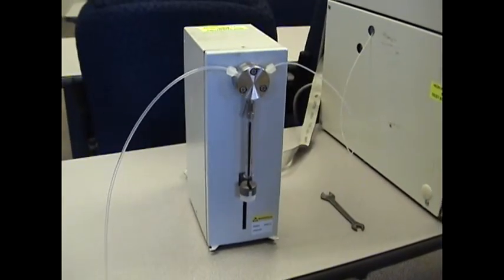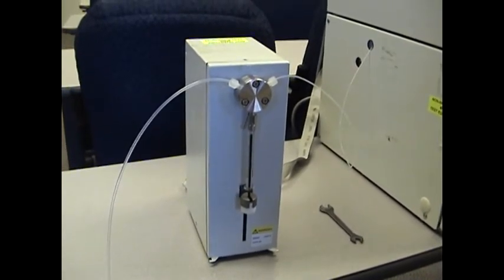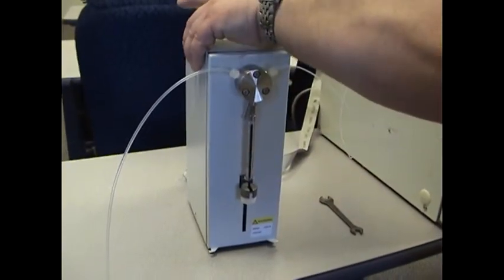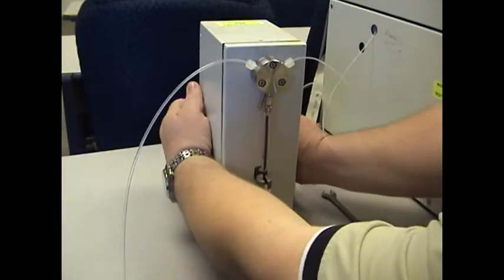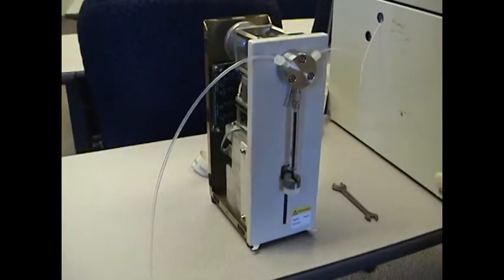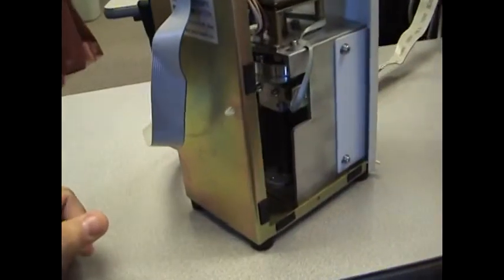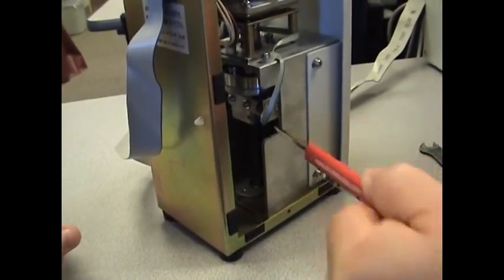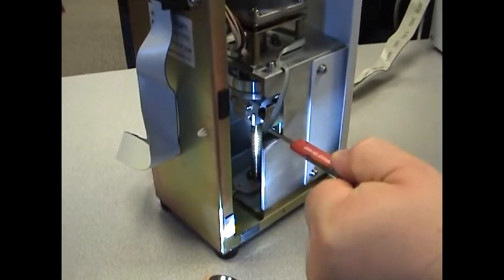A final note on lubrication for the syringe unit. There are five screws that hold the body onto the syringe unit. If you take the cover off with those five screws, the cover just lifts off. There's a worm gear that you can easily access from the back. With the cover off, you can easily see the worm gear from the back side right there.